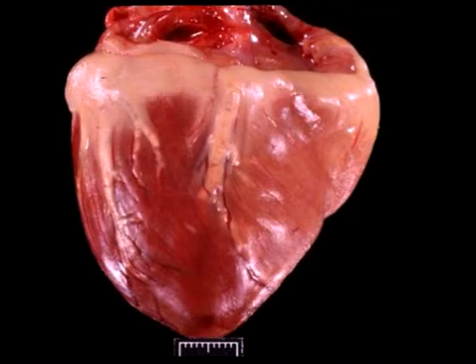The morphologic diagnosis is multifocal coronary arterial atherosclerosis. Look how thick and whitish yellow these arteries are, with a deposition of fat, which is oxidized, partially contained within macrophages, which gives it a yellow appearance.